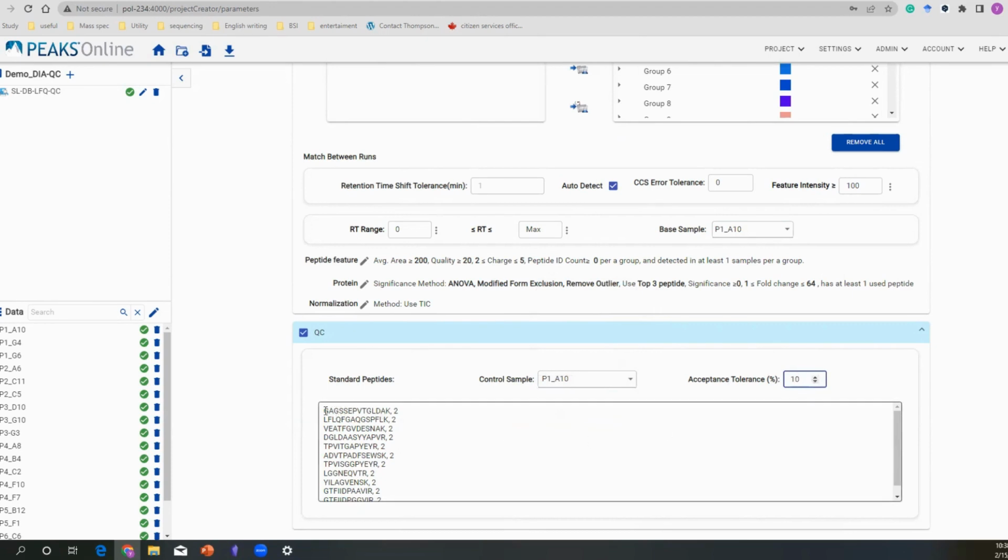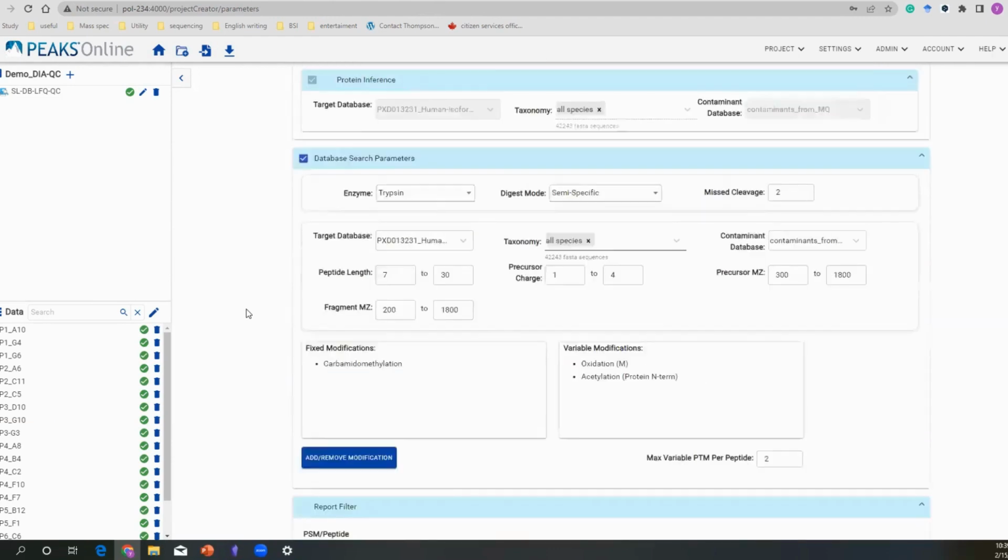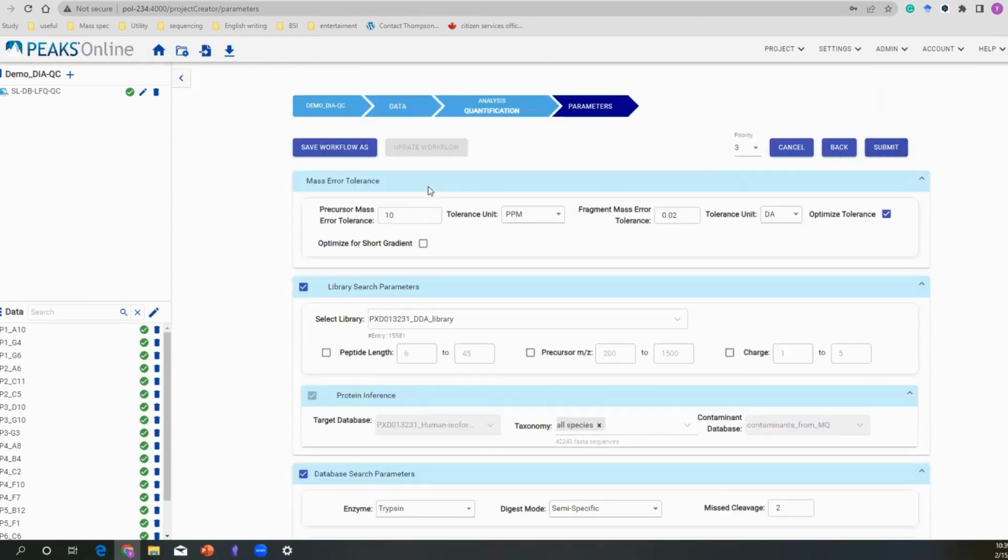And if there are any standard peptides that you would like to use, you can put them in here. It's a very simple process. You have your peptide sequence and your charge state, and just copy and paste here, and then you're good to go. Once everything is done, you click submit. I'm not going to do it here since the analysis is done at this point. I'm just going to show you the direct report, how it looks.